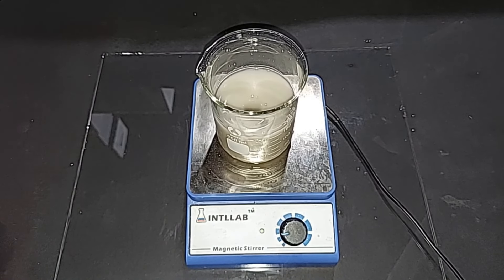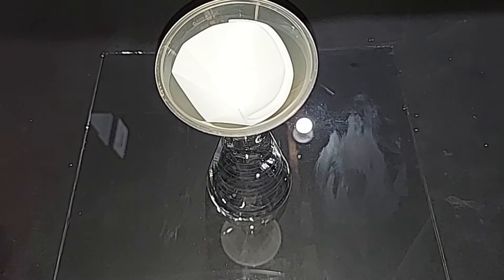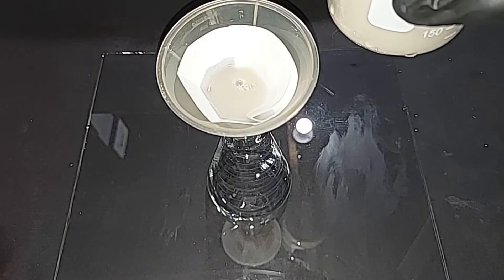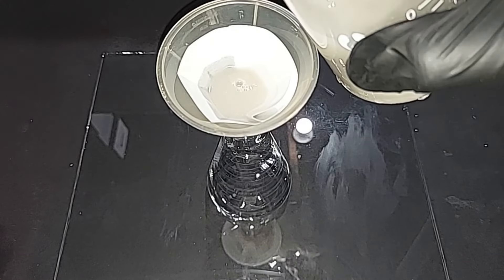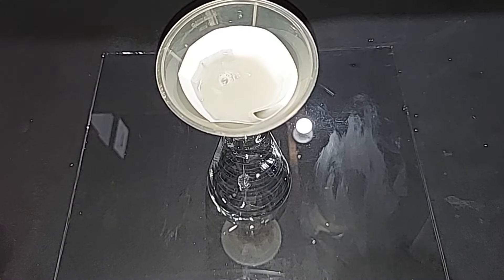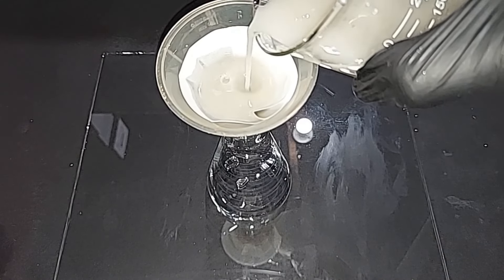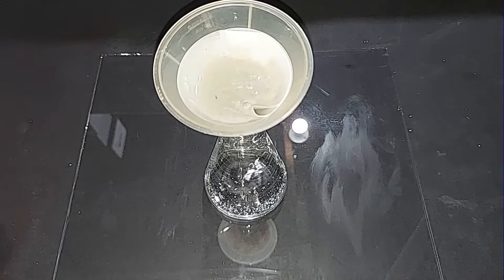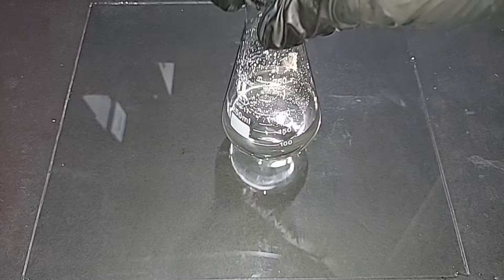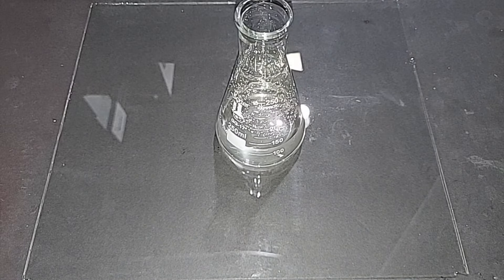The ammonium nitrate prills I used — which I had crushed — came from fertilizer, and it's not uncommon for the solution to be cloudy. So I'm going to filter this first before using it in the experiment. I have a 2 micrometer filter paper which will collect even the smallest pieces, though it'll be slow. After filtering, the ammonium nitrate solution came out really nice and clear, which is what we wanted. Set that aside and move on to dissolving the sodium hydroxide.